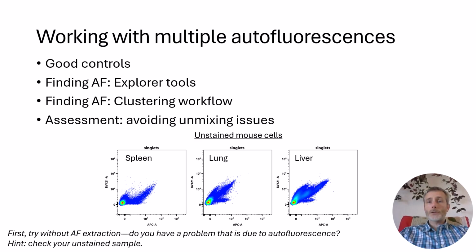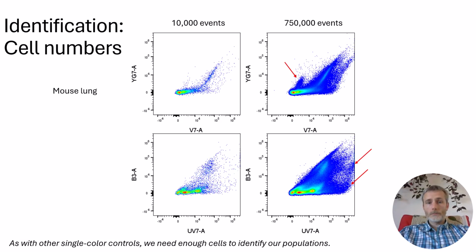If this has substantial signal in your fluorophore channels and diverse signal, such as these examples here with liver and lung, you may need to extract additional autofluorescence signatures. When trying to extract small populations of spiky autofluorescence, we need enough cells to be able to robustly identify these populations to extract the spectral signatures associated with them. If you only run a few events, you won't be able to see the populations that will appear when you run a million events in your fully stained sample.